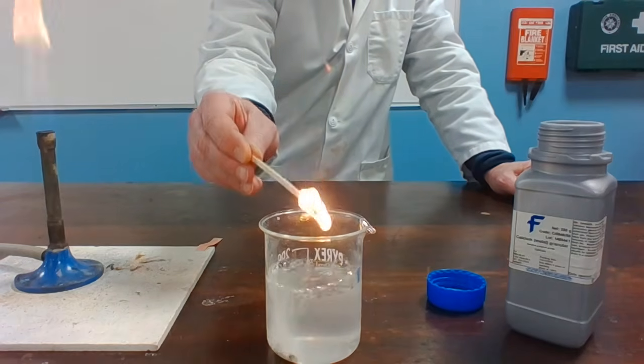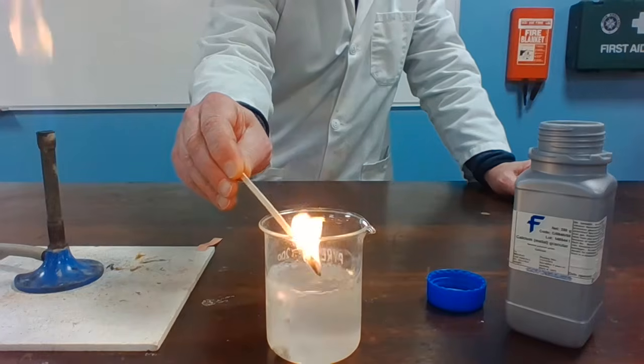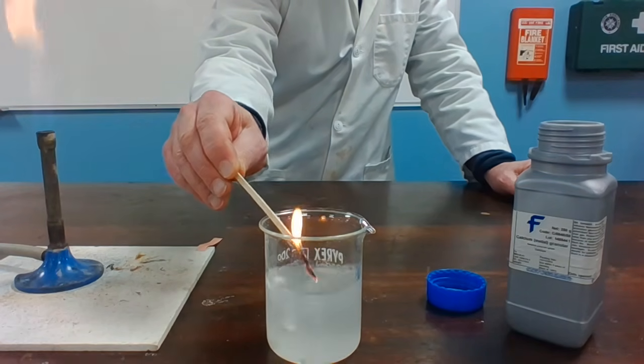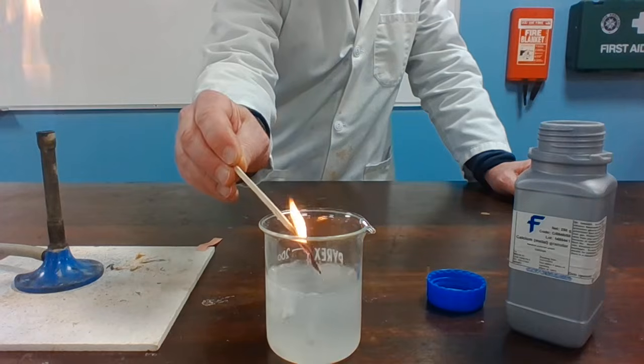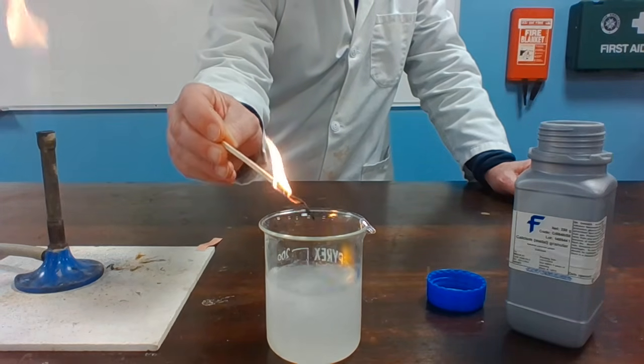You'll begin to see that the gas begins to burn as the gas comes off. Hydrogen burns there.